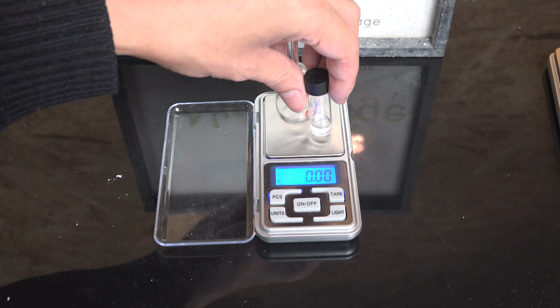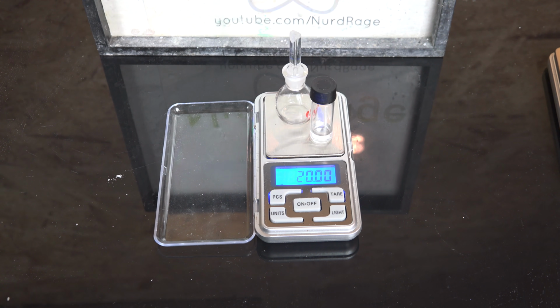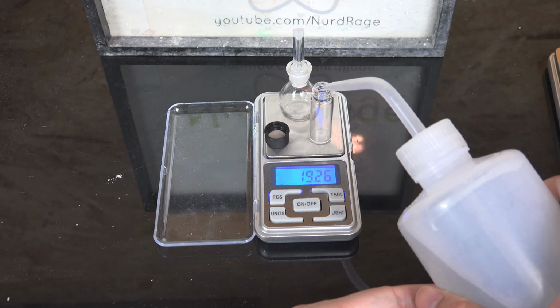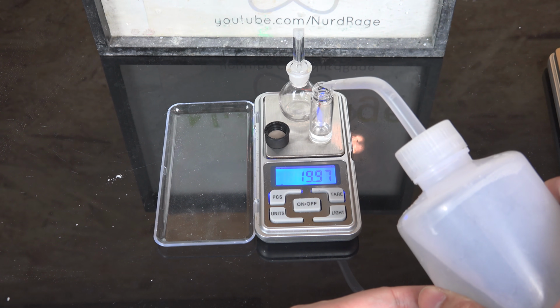Granted, I still had to do the division by volume on a calculator, so I didn't win by any means, but those 10 seconds per sample felt a lot easier when I didn't have to spend 2 seconds typing in the subtraction. Anyway, I tell this story just because it's more fun than explaining what a companion weight is for. It's like a physical tare function and is useful for when you can't tare the scale.